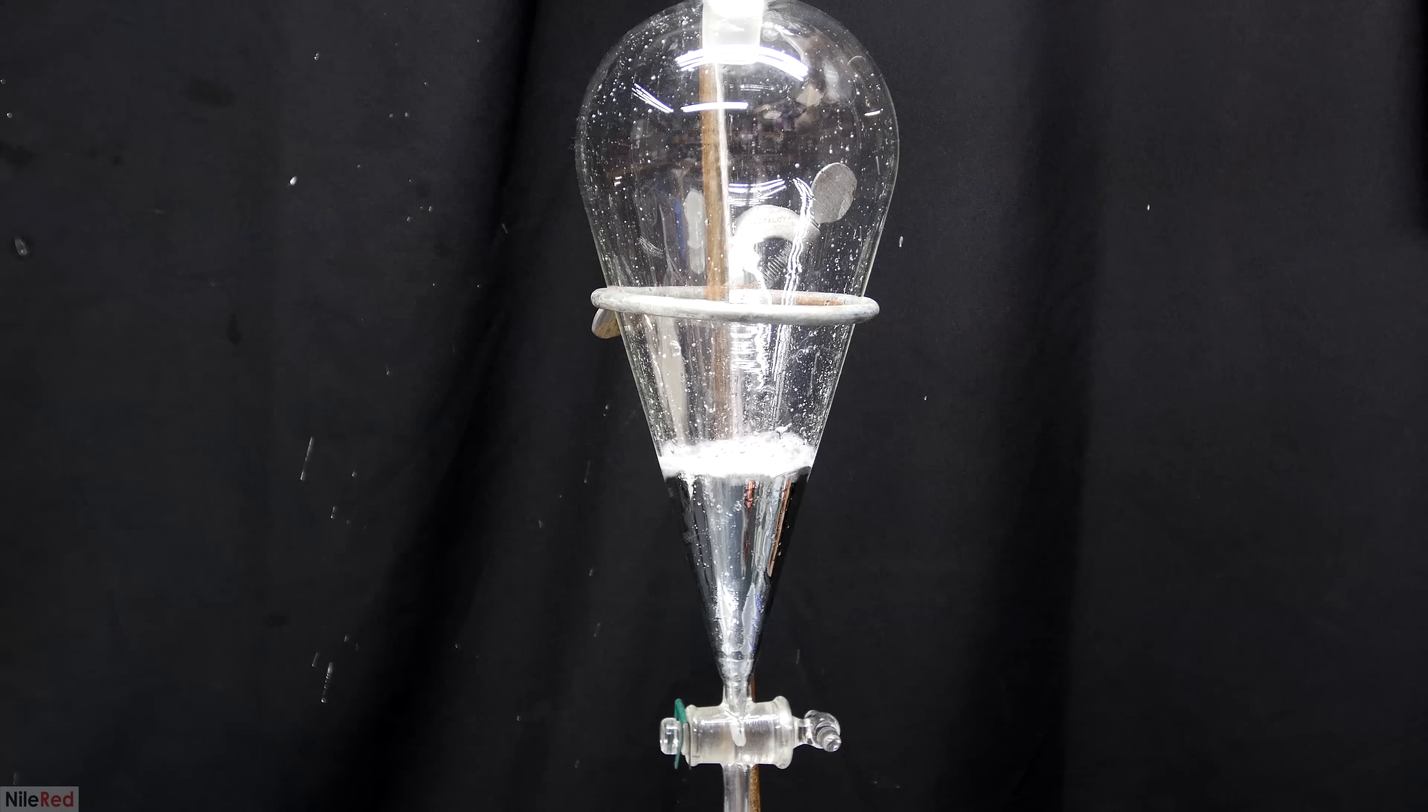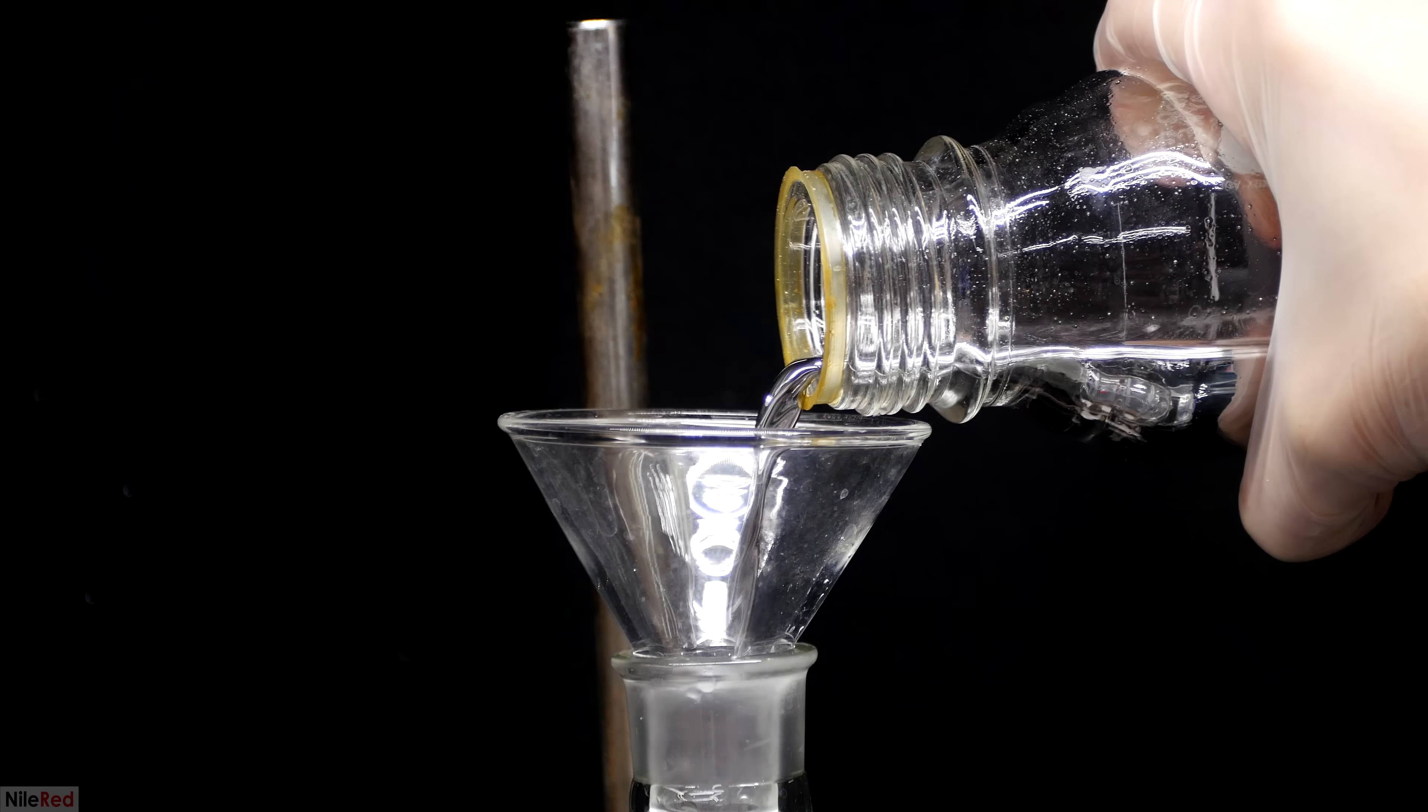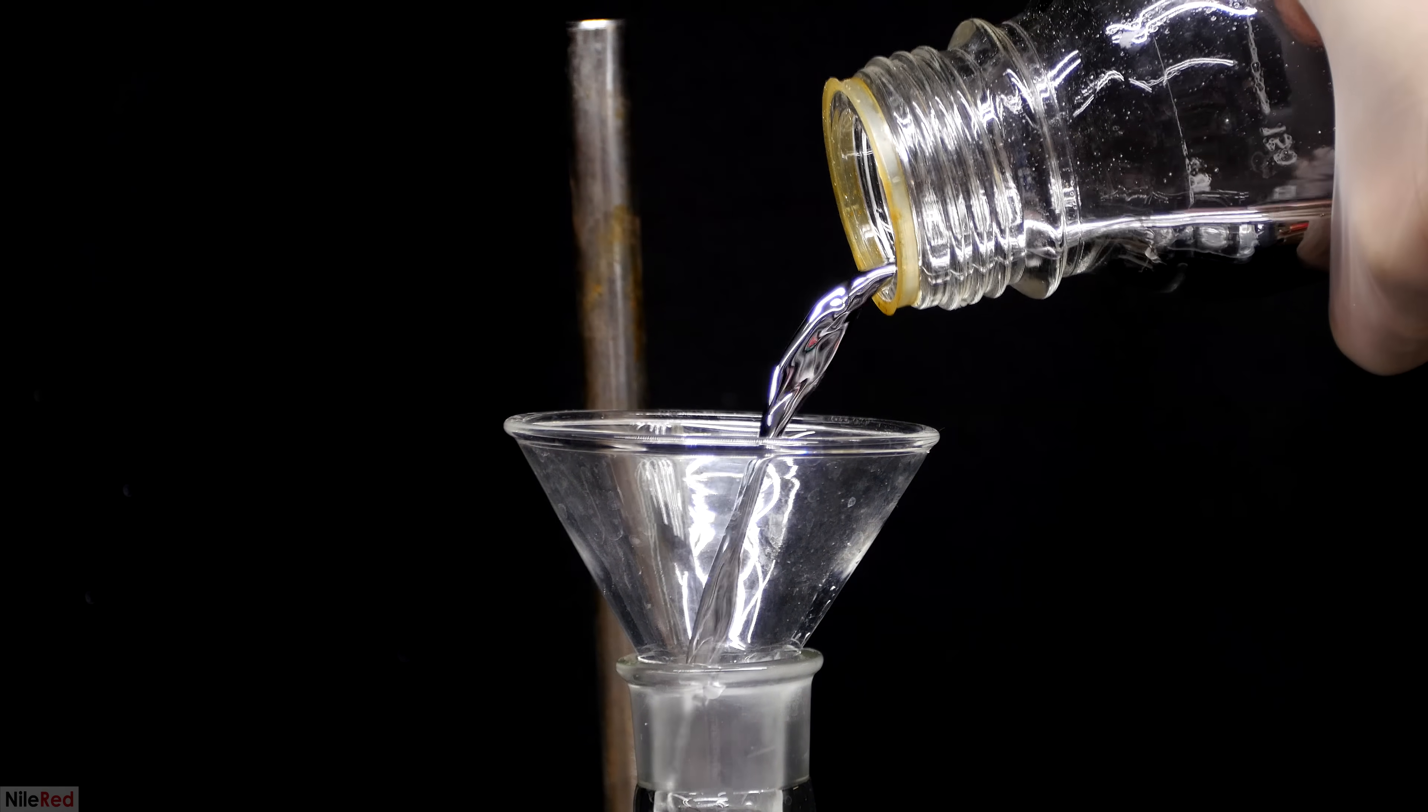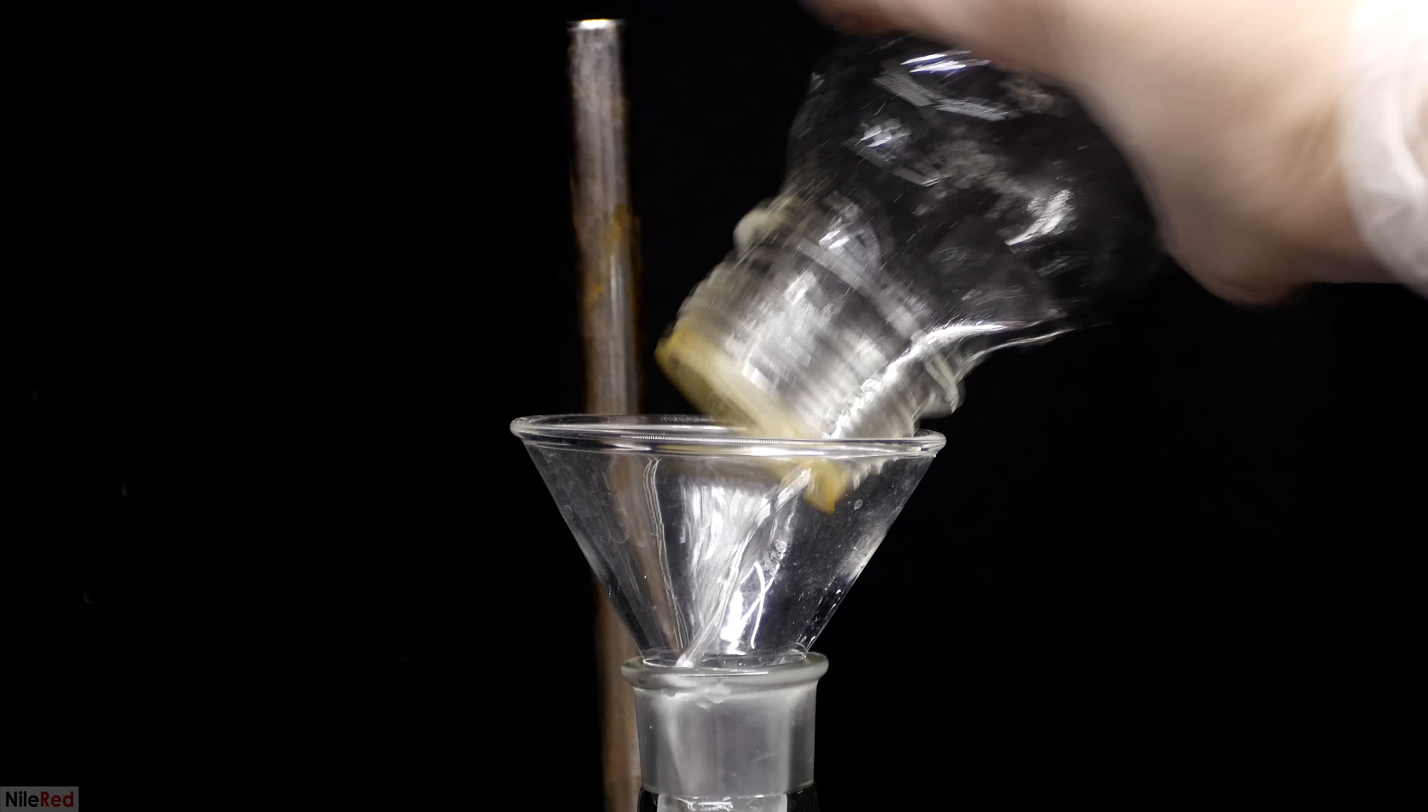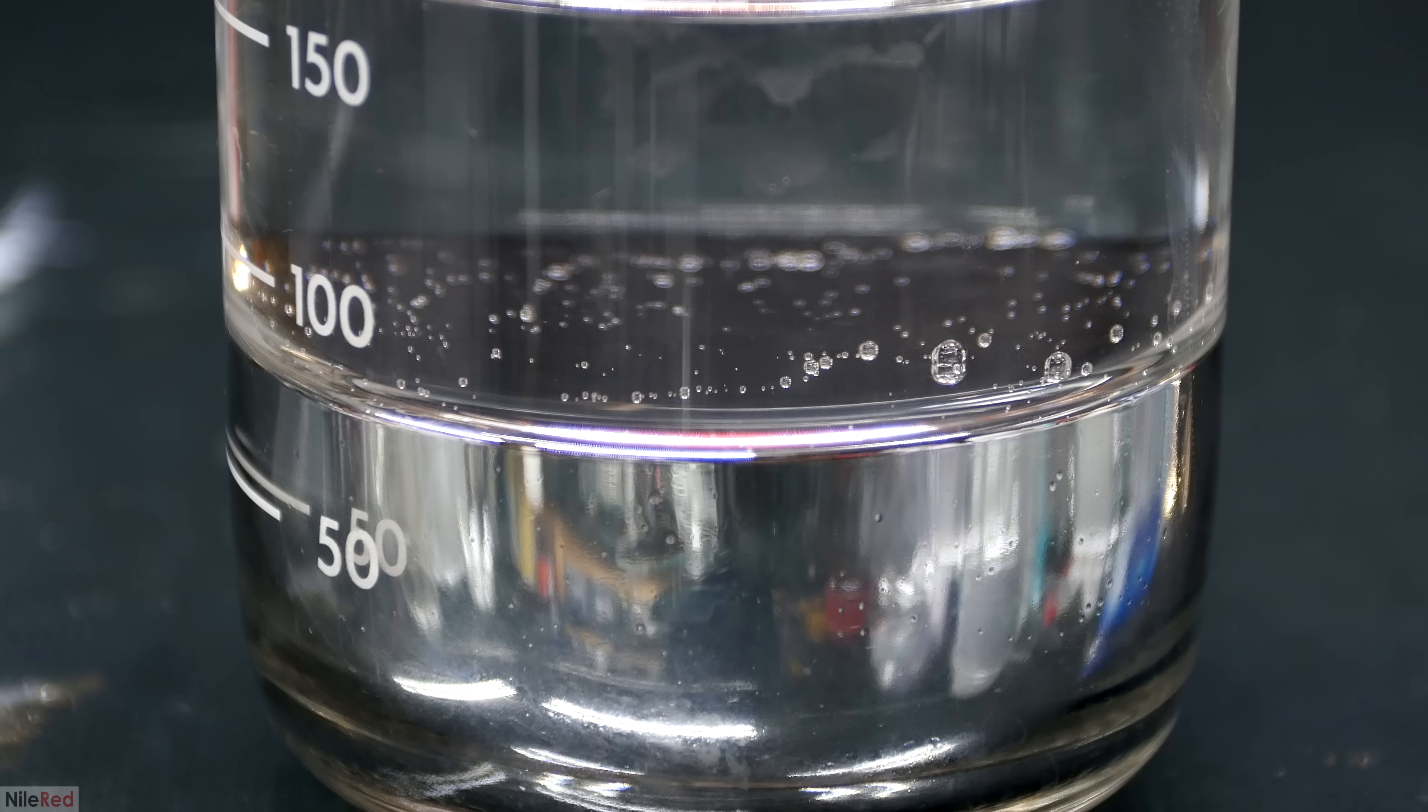After the initial cleaning steps, the mercury is actually pretty clean. I went ahead and used it in several reactions with absolutely no problem, but I decided that in the end I did want to distill it. Distilling the mercury will definitely increase its purity, but I did it mostly because I thought it would be cool to see.